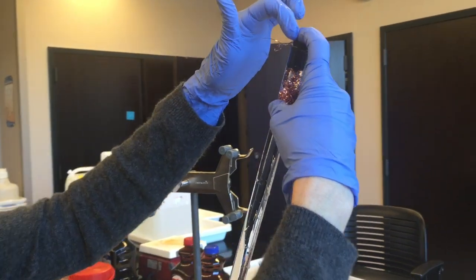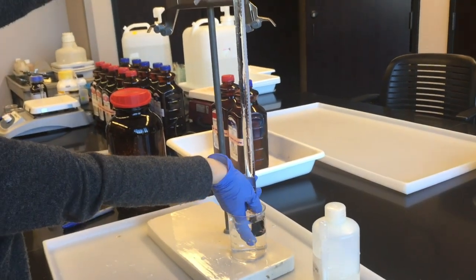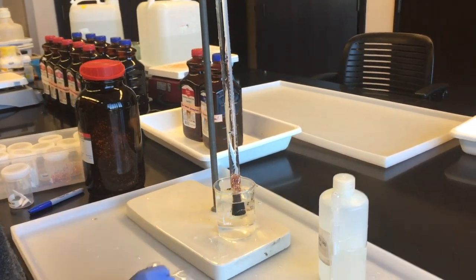You have your finger on the hole of that stopper and you flip it upside down and put it into the water in the beaker. That is exactly what we want.